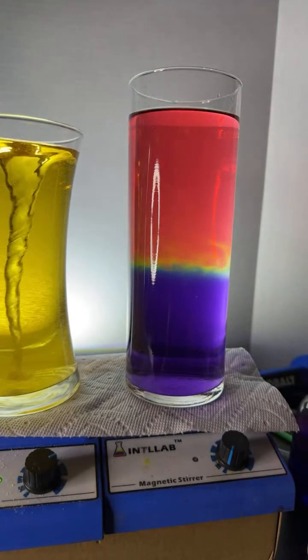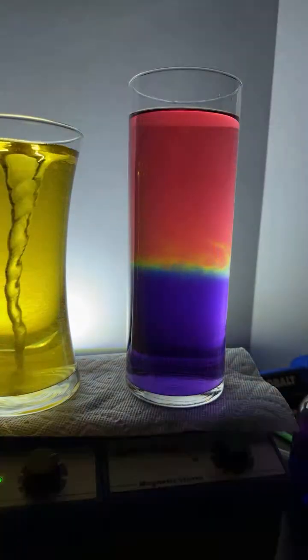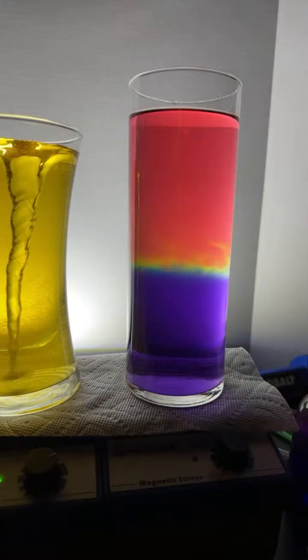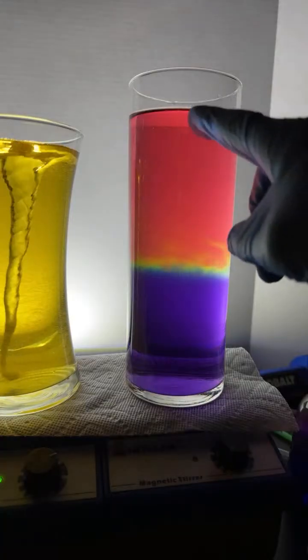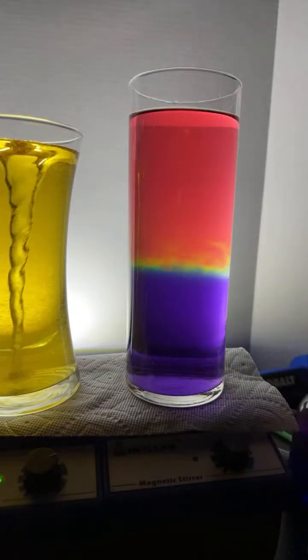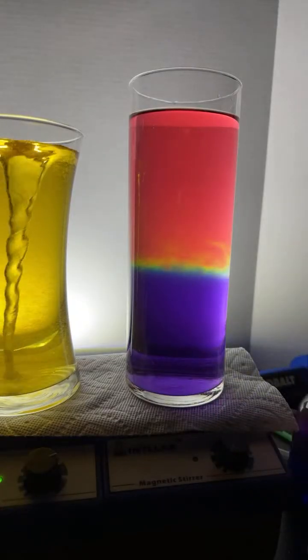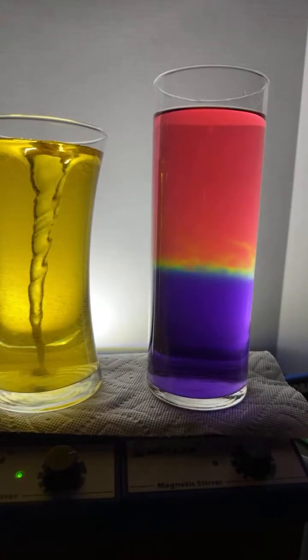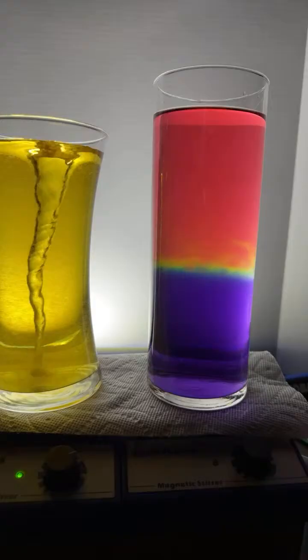Hello there, James. So, using the heart emoji of your choice, let us know in the chat what color you think this will be when I mix it up. Let's see what we got. Who's going to guess what? What color will this be after I mix everything up? Show me with the heart emojis.